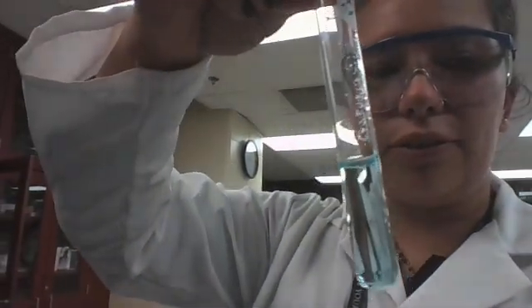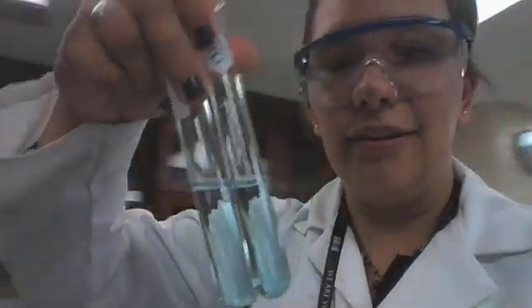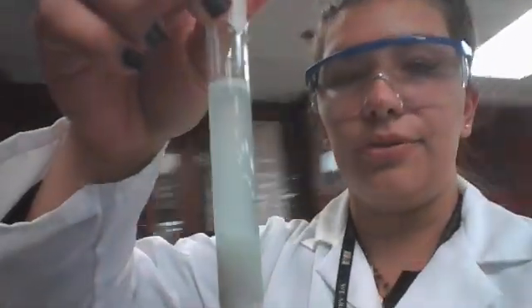So what that's going to look like for our test sample is here's some sugar in our blue solution. It's our control, positive. And here's some water with solution, and it's our control, negative. So these get taken to a hot water bath over here for 3 to 5 minutes. We're also going to take our stomach sample, again, with blue solution added to it, into the water bath for 3 minutes. We'll come back to those ones.